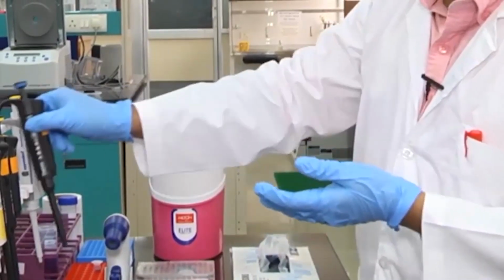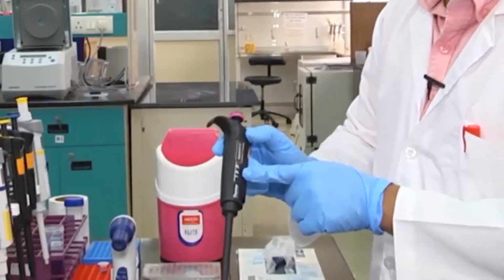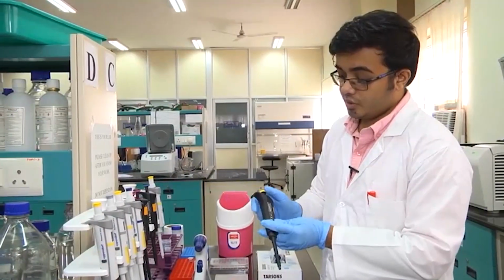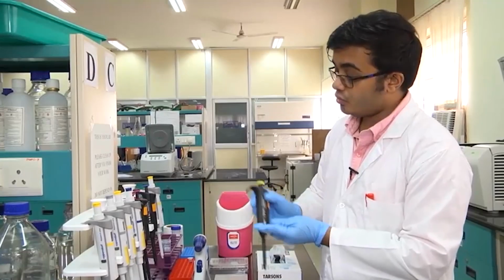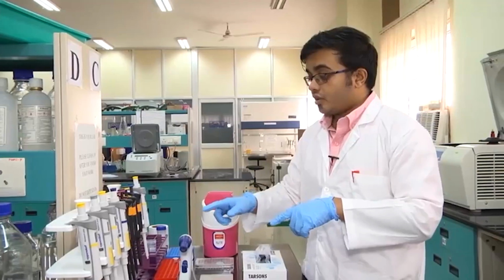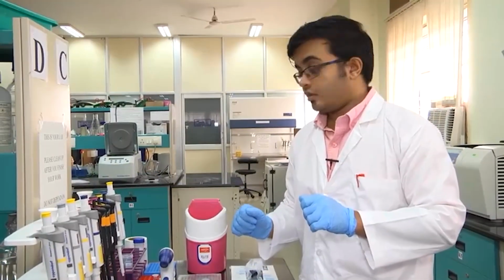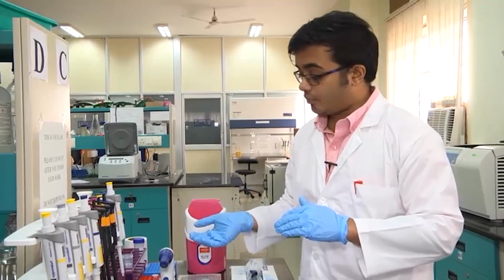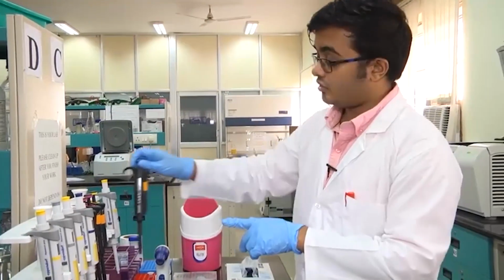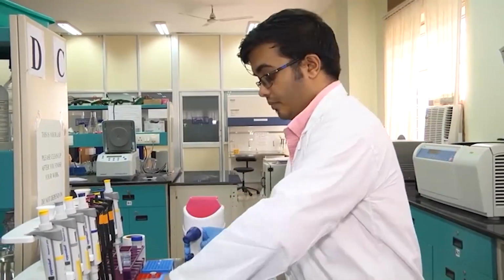This is applicable for all the different pipettes here. For 1 to 10, it will be kept at 10 microliters when not in use. For 10 to 100, you keep it at 100 microliters when not in use, and so on. So, I had been talking about collecting 1 ml. Suppose I want to collect 5 ml or say 10 ml of a particular solution, in which case instead of using this 10 times, I would like to use this once.